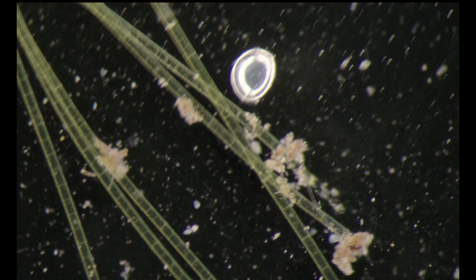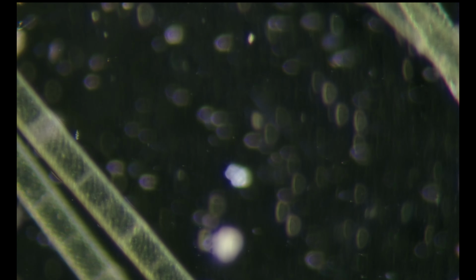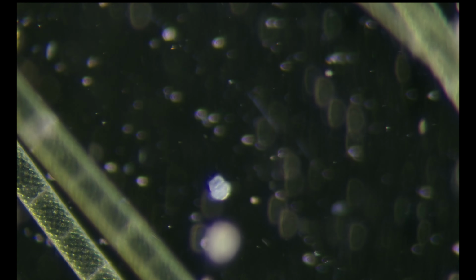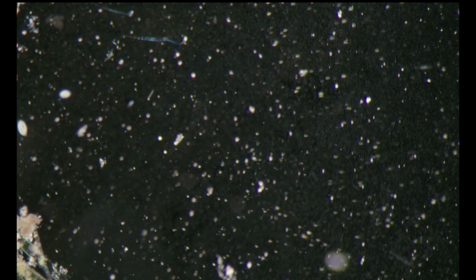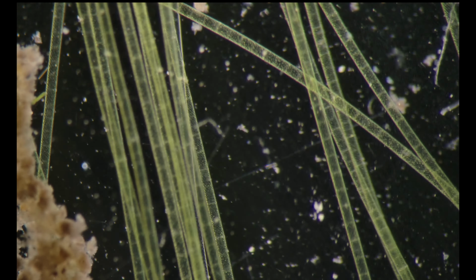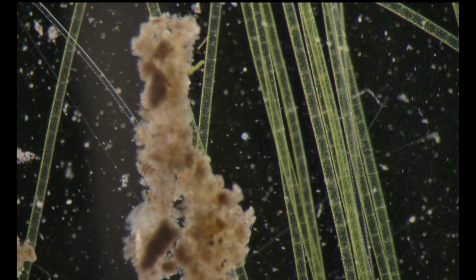The ability to zoom in and out gives us a very nice perception of our creatures in different magnifications. Once we are accustomed to seeing them in high magnification and low magnification, we can easily spot them and identify them.